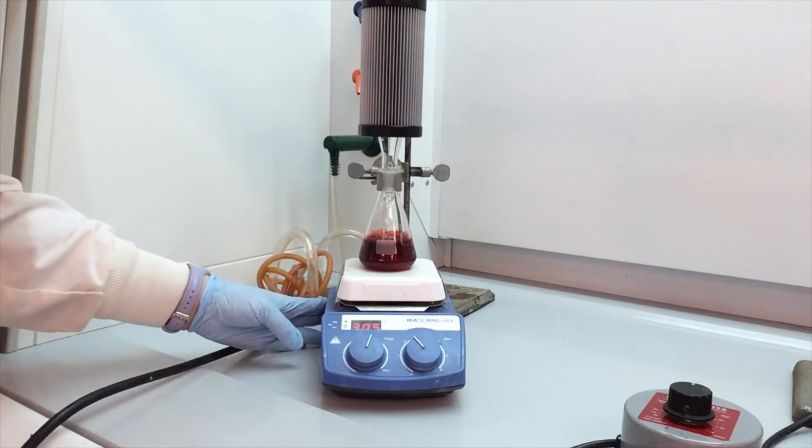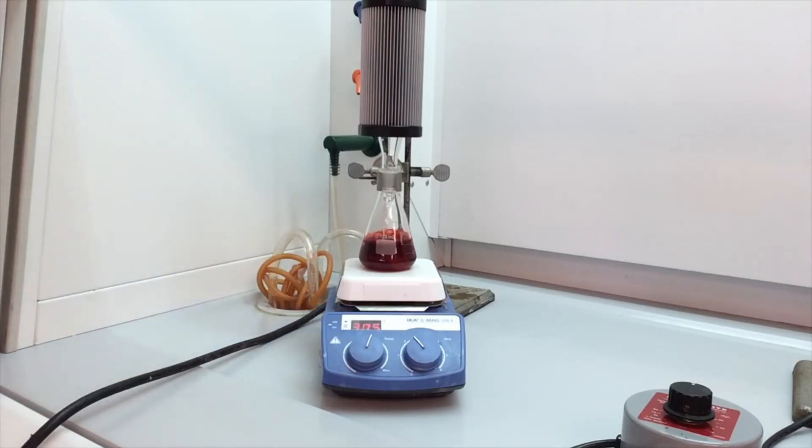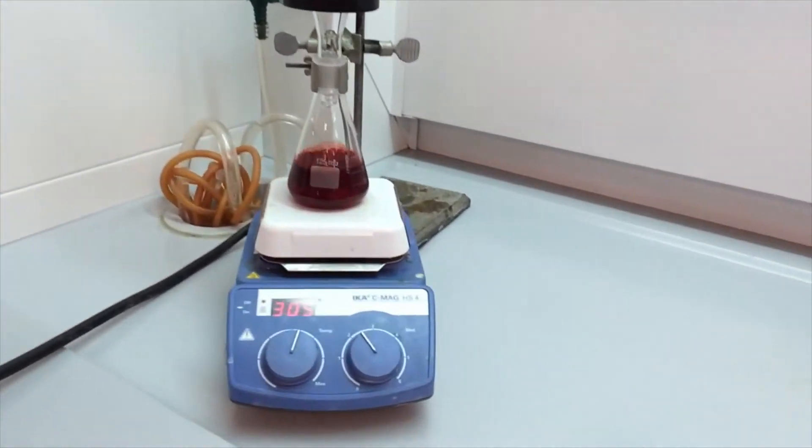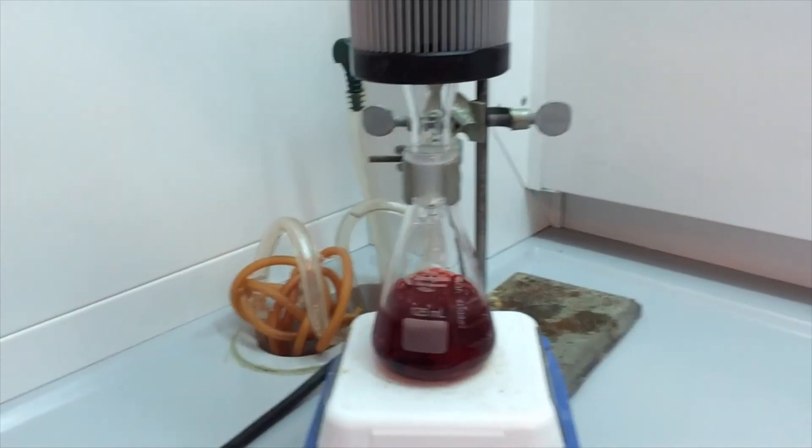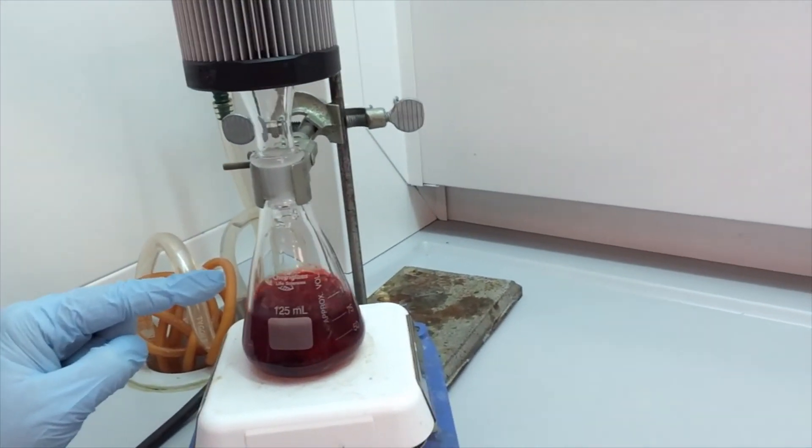So it looks like this reaction is now refluxing. Let's zoom in, take a better look. So our solvent is boiling.